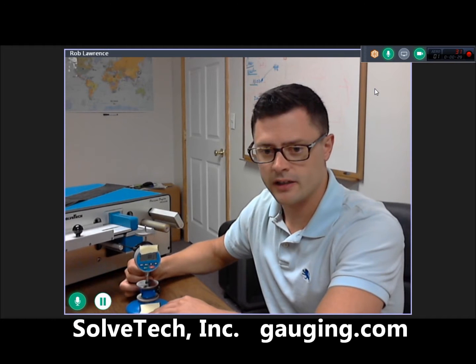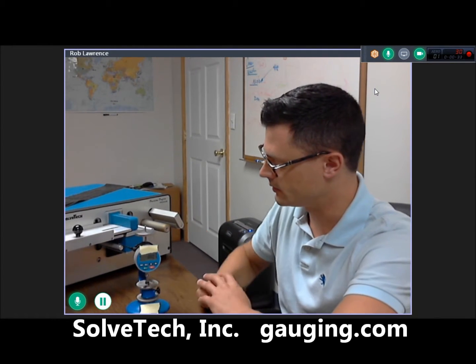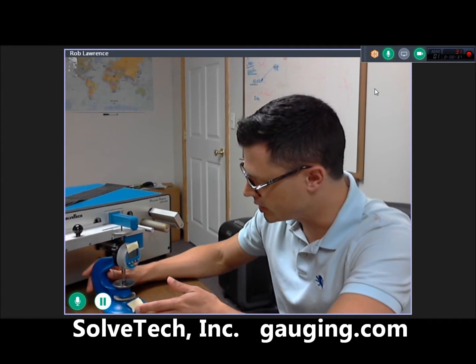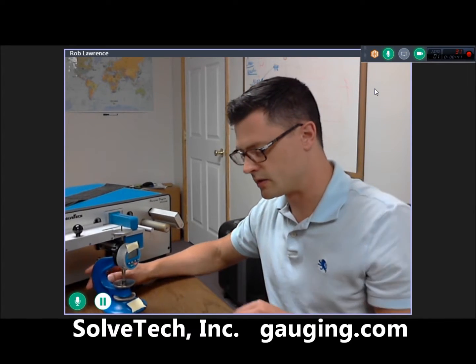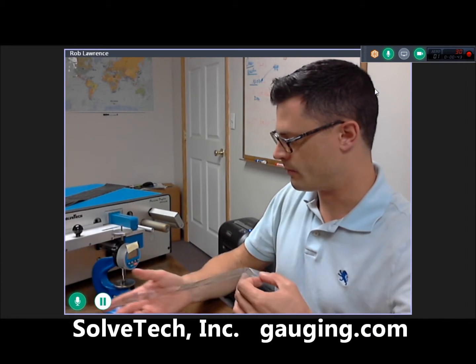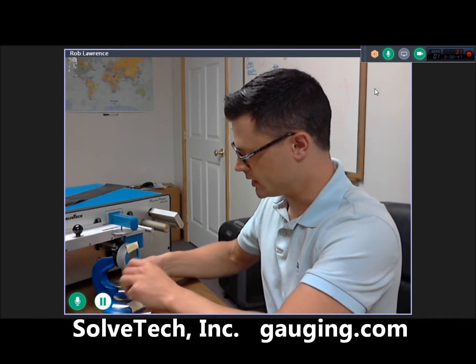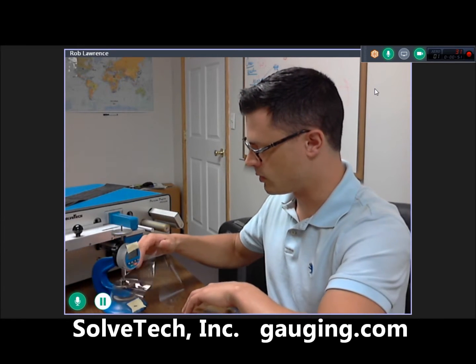So here I have a contact thickness gauge. Pretty simple device. It's inexpensive and easy to use. It's calibrated using a steel shim, so it's not exactly NIST traceably calibrated for plastic film, but it still gives us a pretty good idea on thickness. So I go ahead and put this in, and I can get about 24 microns.